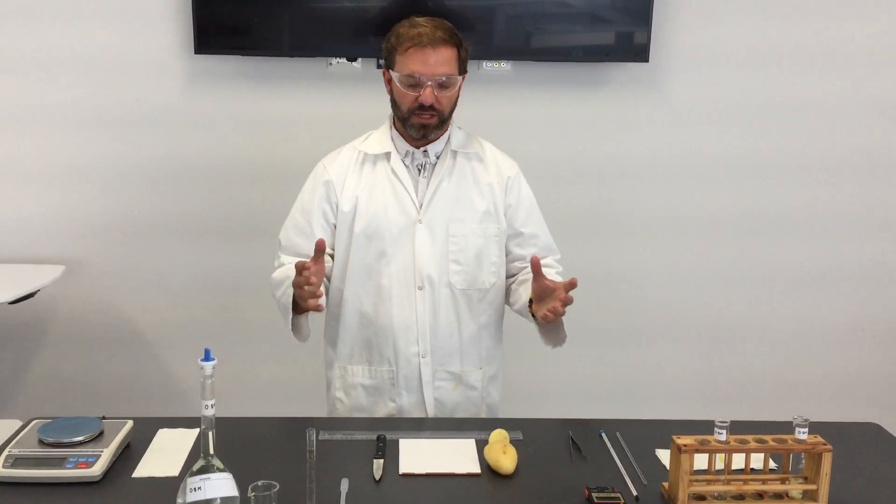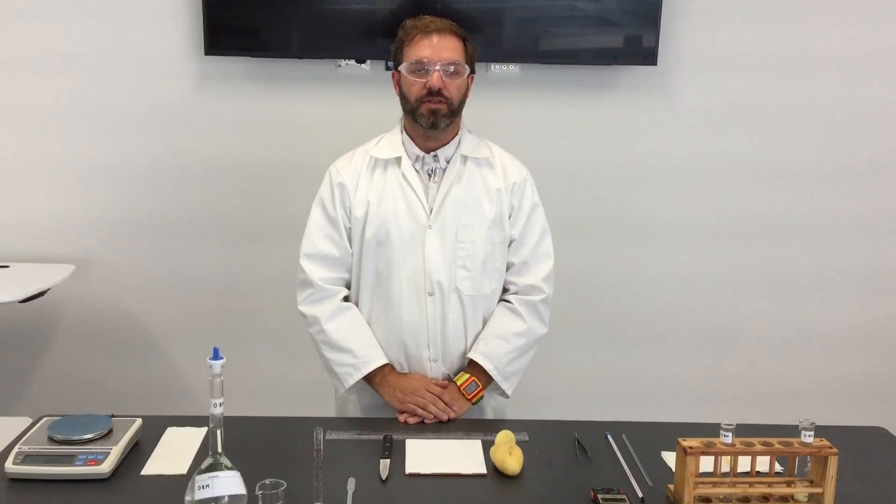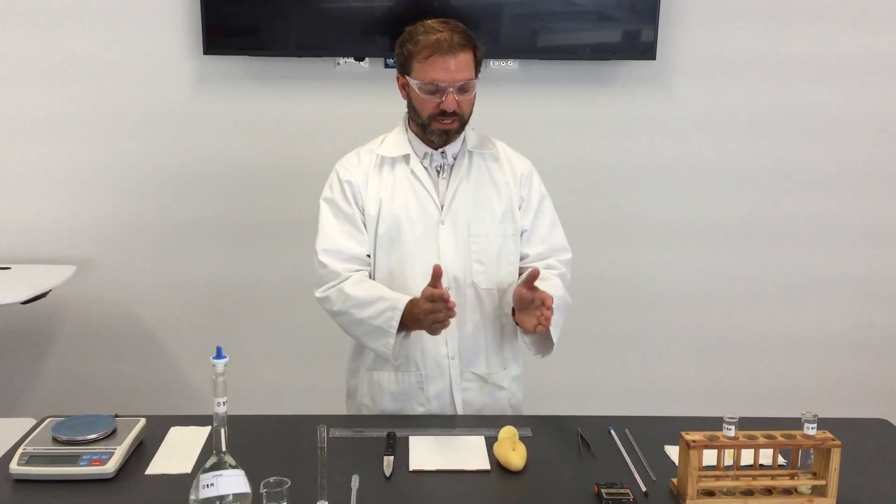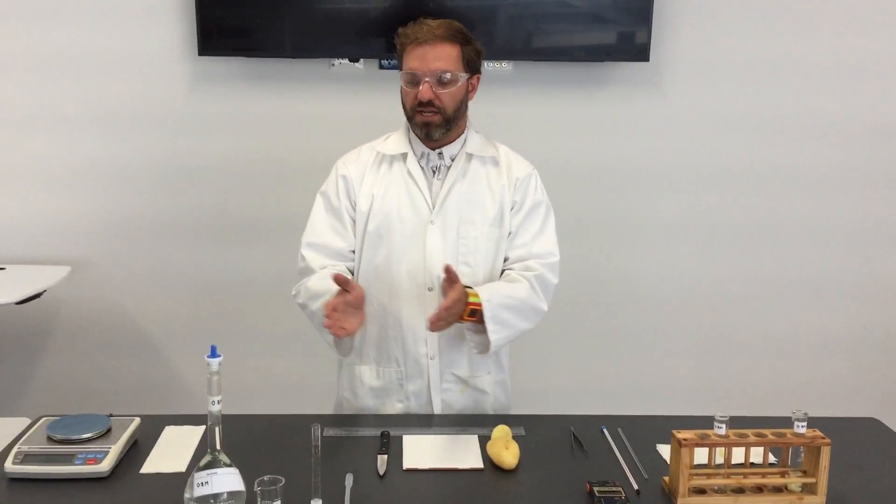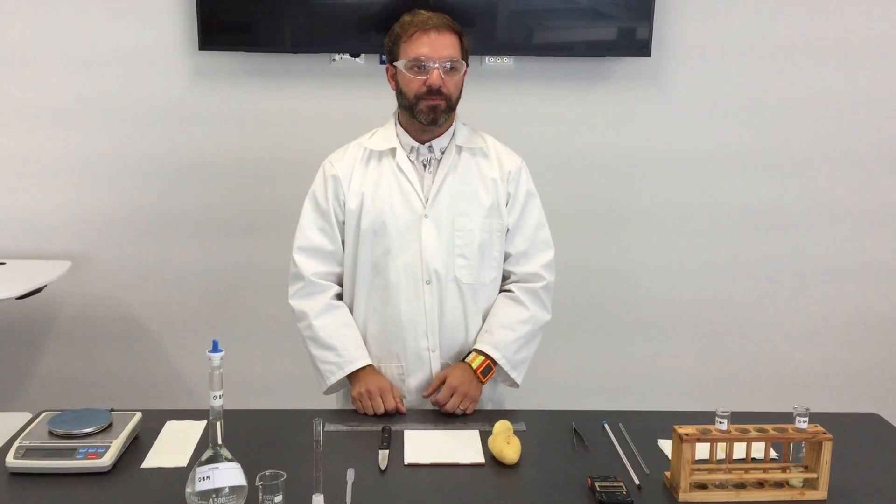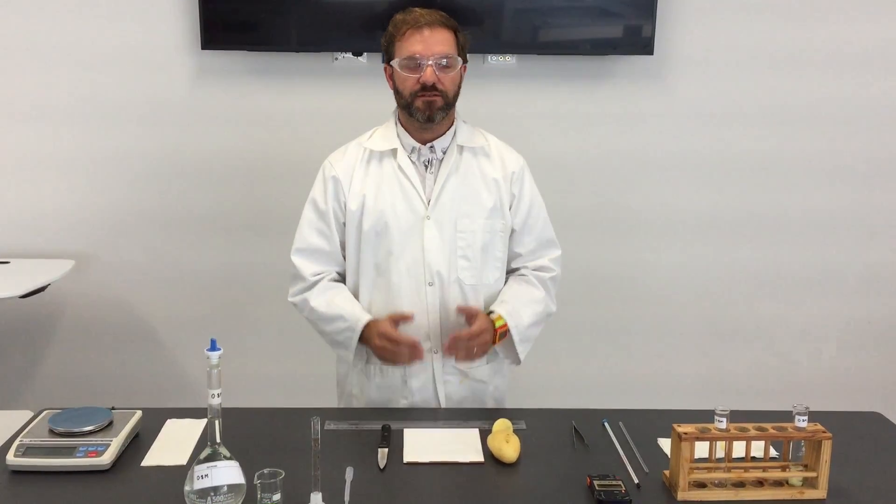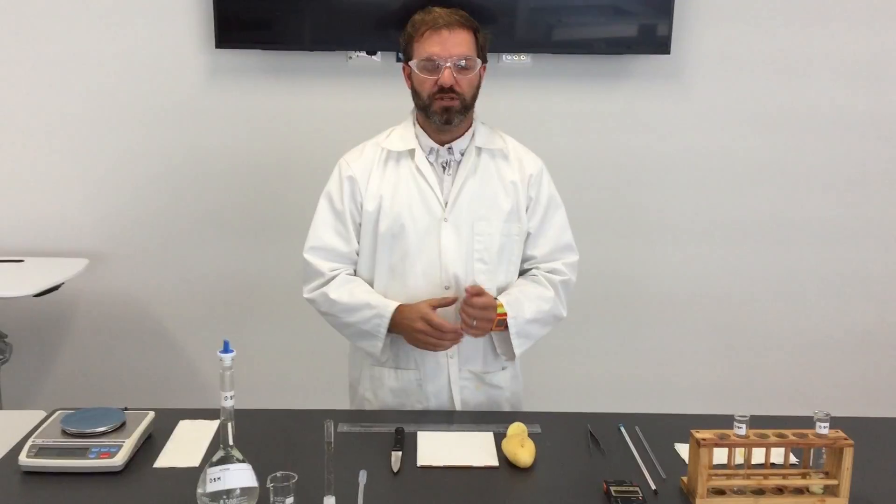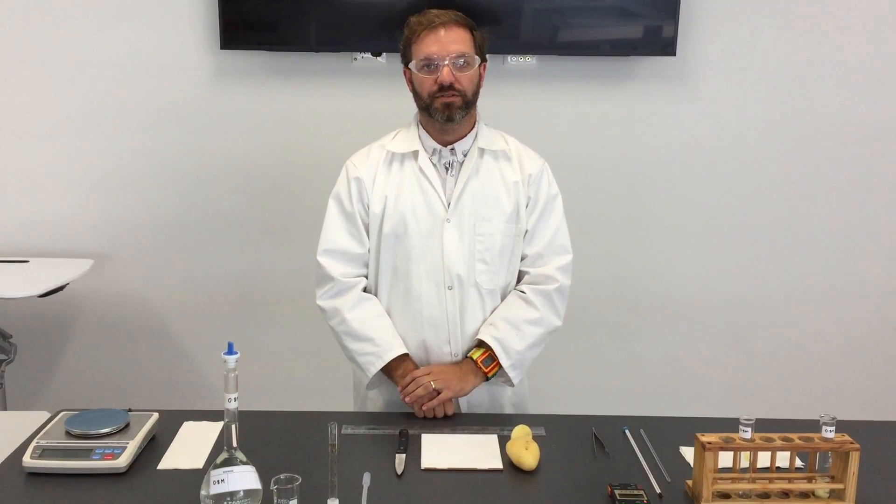Okay, welcome to this video where I'm going to quickly go through a demonstration of the method for the osmosis practical. This practical involves pieces of potato which are incubated in sucrose solution for one hour. In this demonstration we will see the effect of that incubation on the mass of the potato, which will give an indicator of the presence of osmosis.